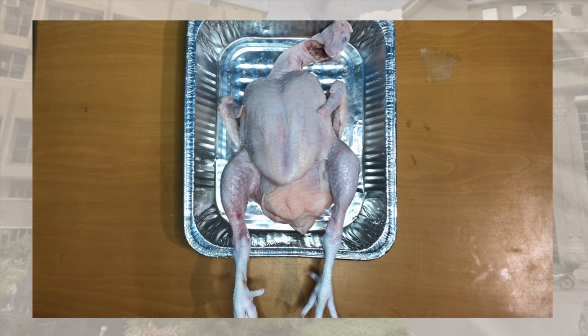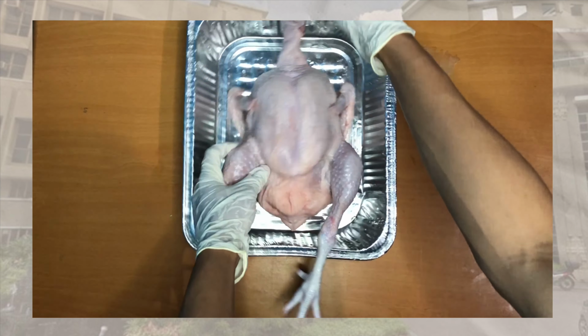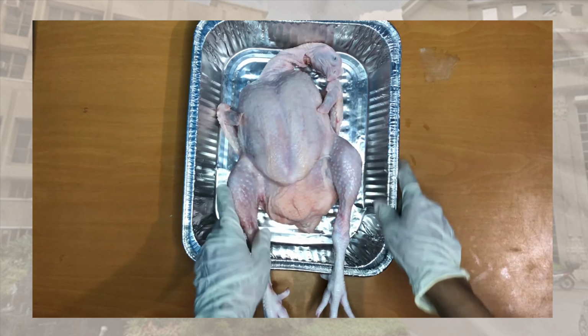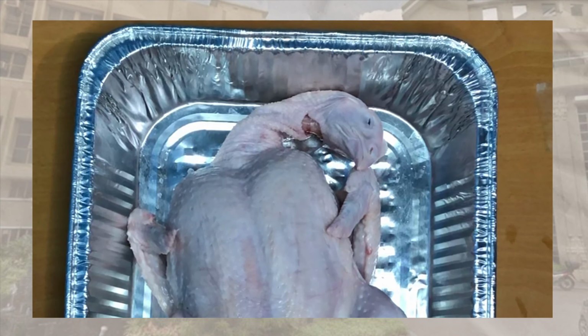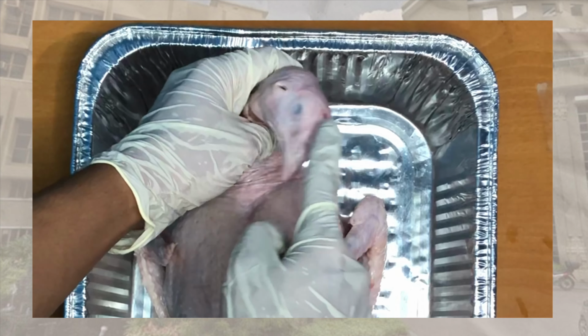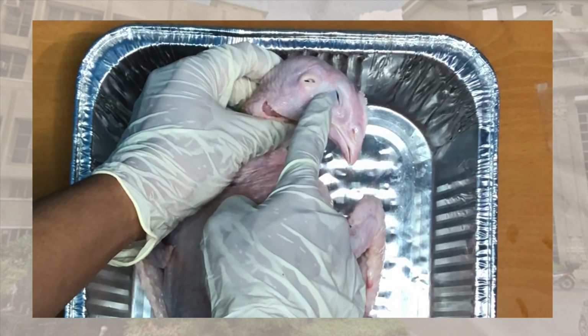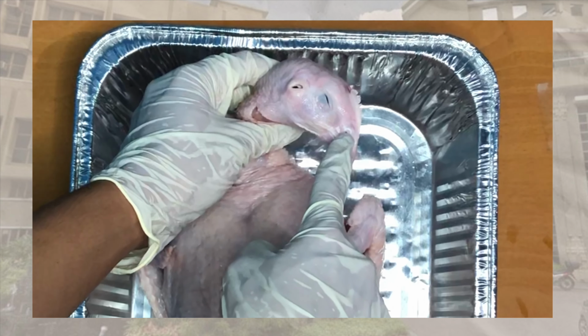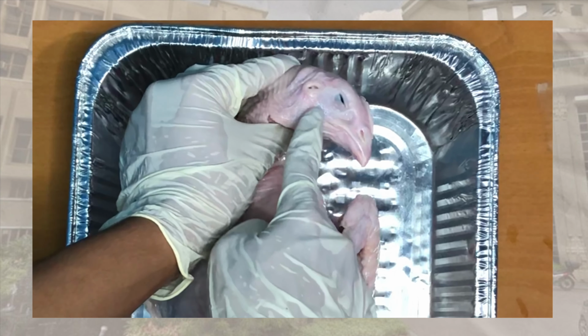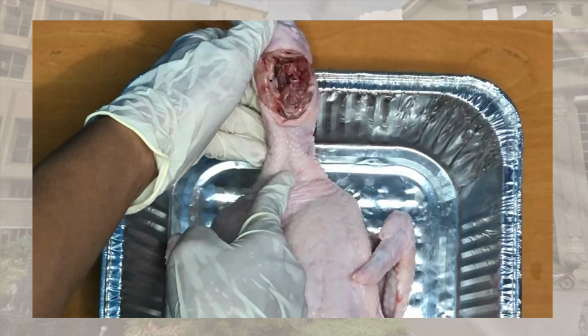Second, they identified the regional terms of the patient. The body is placed in a supine position to allow anatomical structures to remain in natural neutral alignment. Under the cephalic area, there are frontal, orbital, nasal, oral, and mental. Here is the cervical.